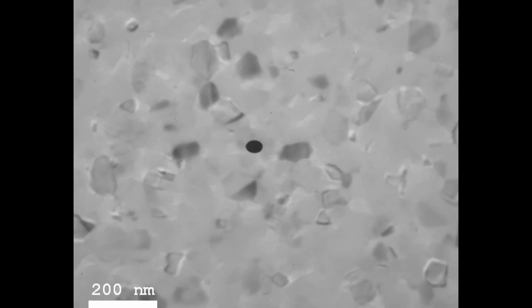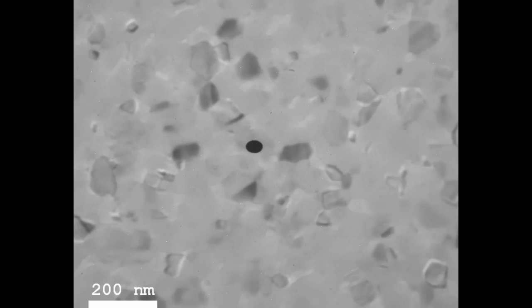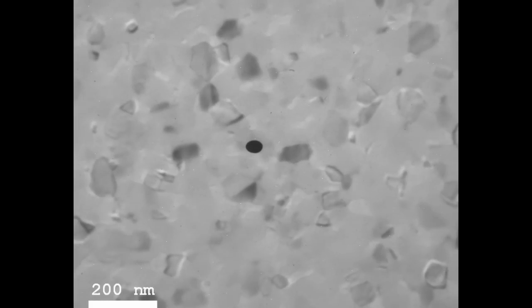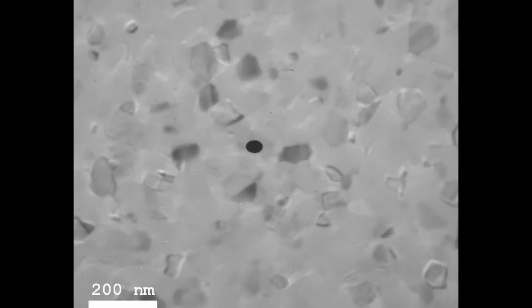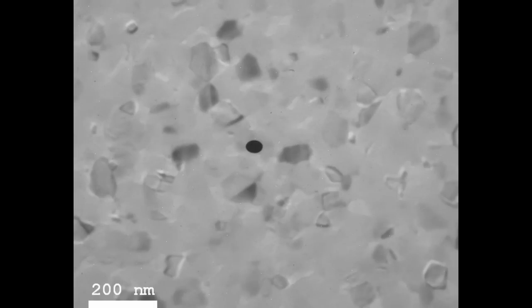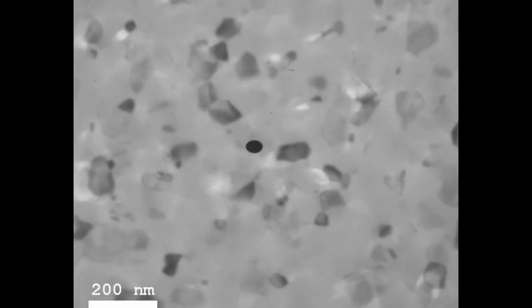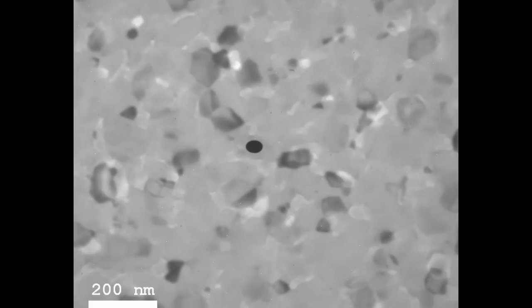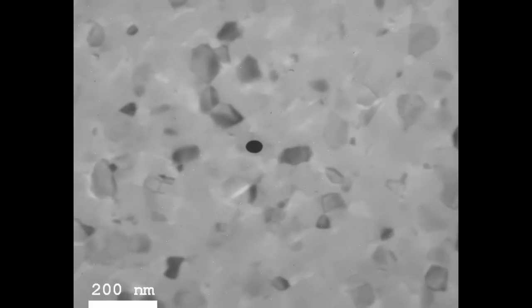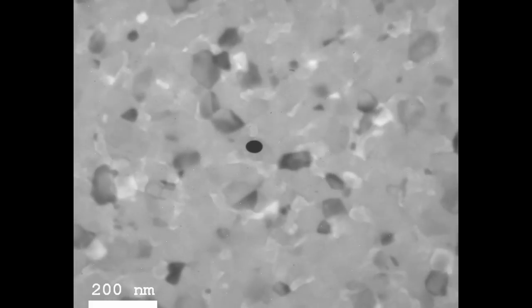How much these white and black regions are offset depends on the strength of defocusing of the objective lens. Some regions become black because fewer electrons hit that part of the screen, and white regions are brighter because more electrons hit there. I can change the defocusing strength, and as I turn the focusing knob you can see these ghost white images move out and come back to the grain edges.